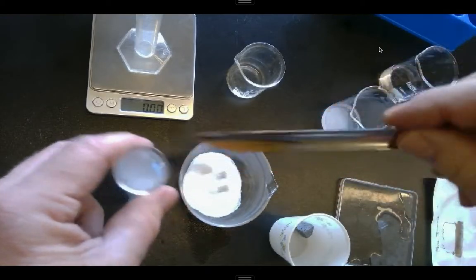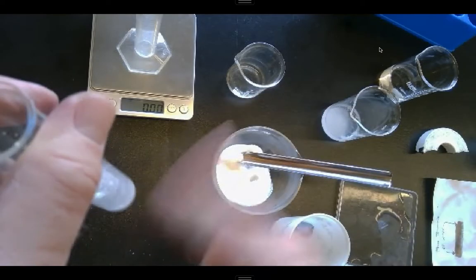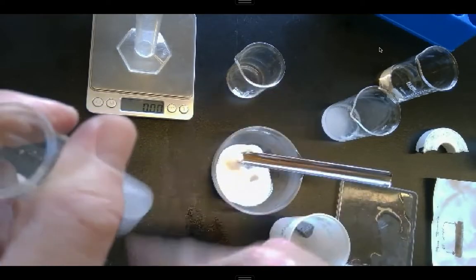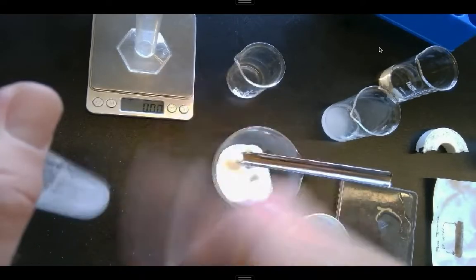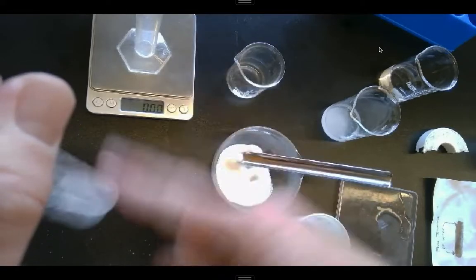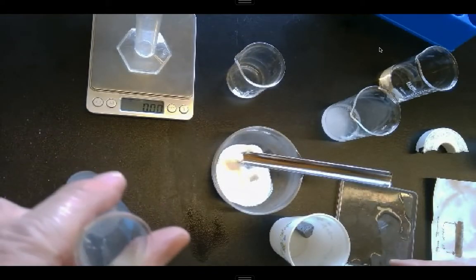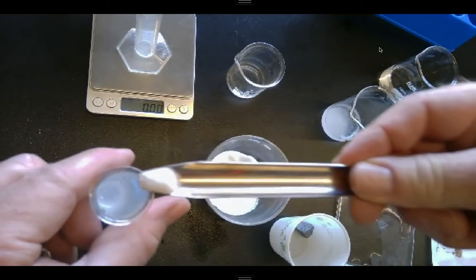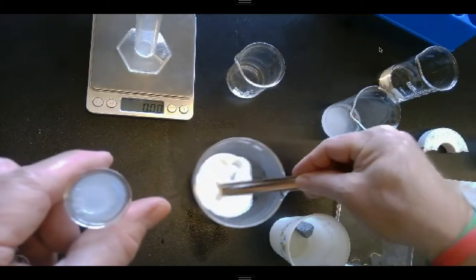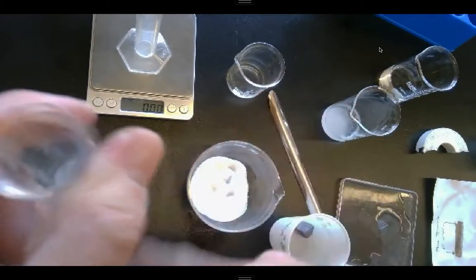And when I first just drop it in, it settles to the bottom real quickly, but sometimes you need to agitate it a little bit. And if I hold it at the top of the test tube and tap it, I'll get more of that salt to be able to dissolve. And so a lot of that excess that was at the bottom now is gone. So I'm going to add some more in here. Again, I want to try to dissolve as much as I possibly can.